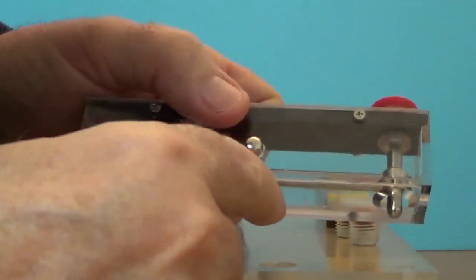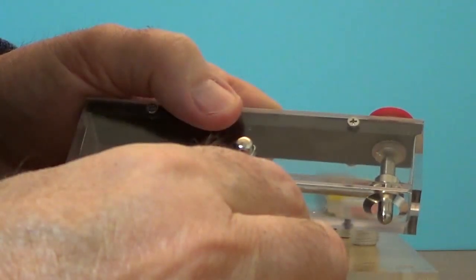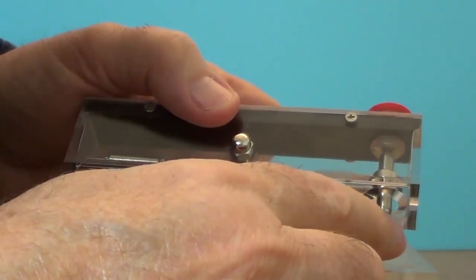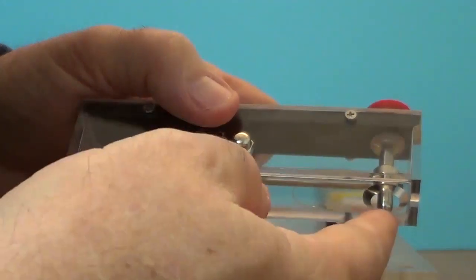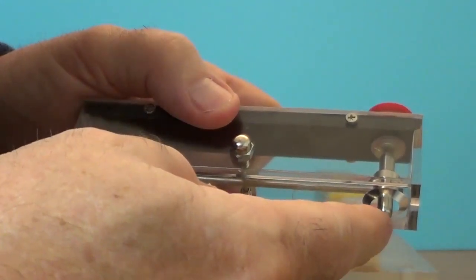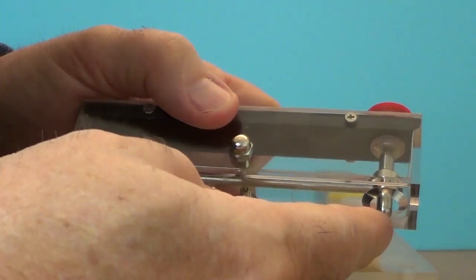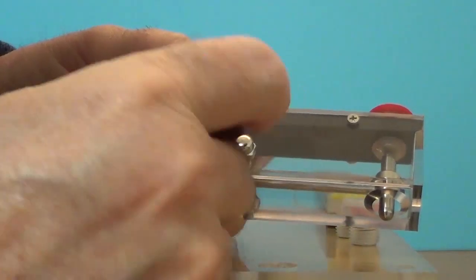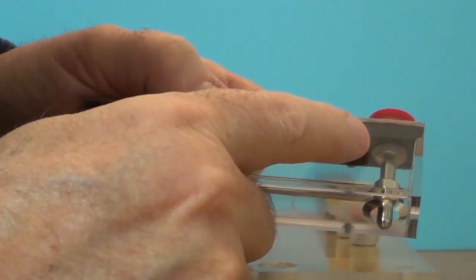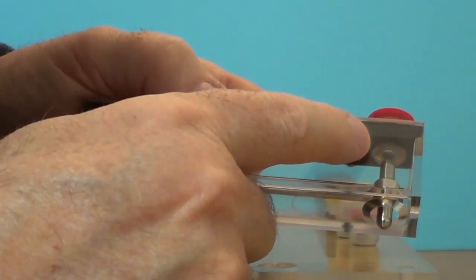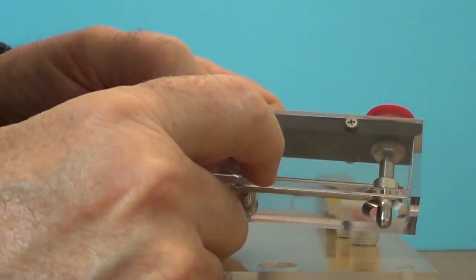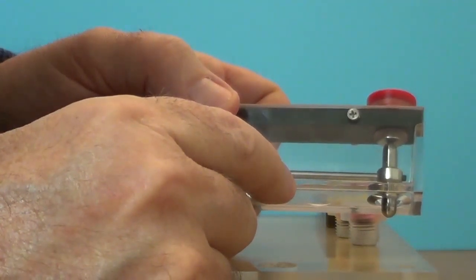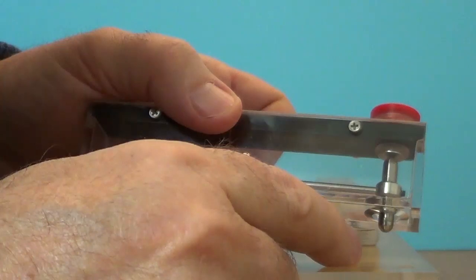The mechanism or the principle behind this device is that this end of the bar magnet that sticks out, protrudes out the bottom, is going to come into contact with the test specimen. And there's going to be an attractive force exerted between the bar magnet and the test specimen at the bottom. There's also an attractive force exerted between the top end of the bar magnet and the bottom of this calibrated insert that we have. In this case again the 105. And what I'm going to try to do is determine which of those two attractive forces is larger.